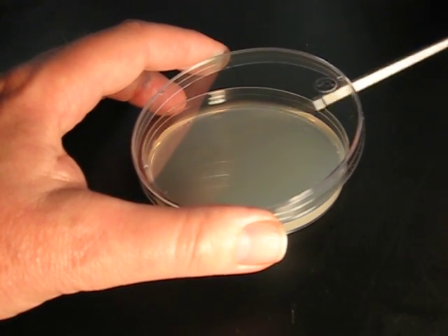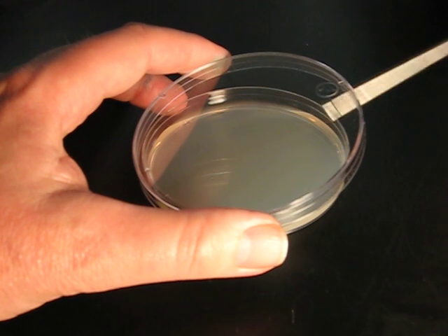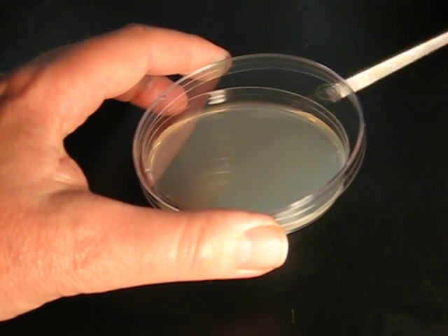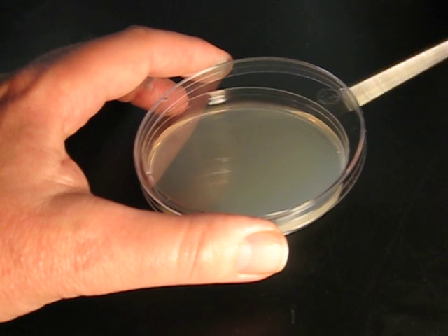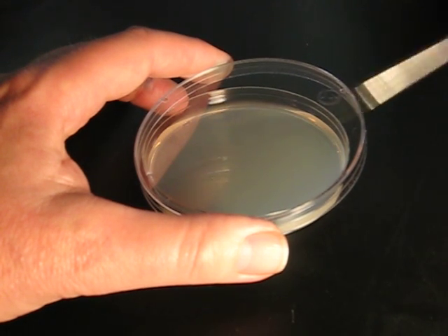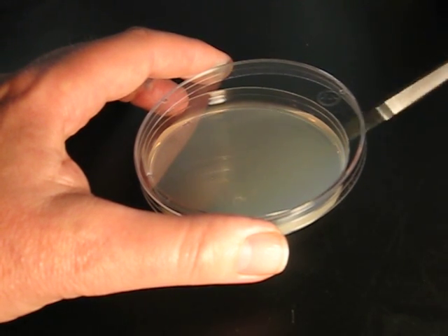Note that the lid is lifted just enough to allow the loop to enter the plate. The loop is streaked back and forth across the surface of the medium, depositing fewer and fewer organisms as it goes.